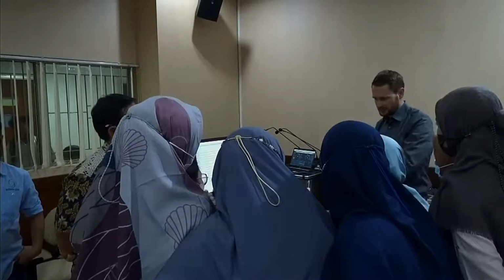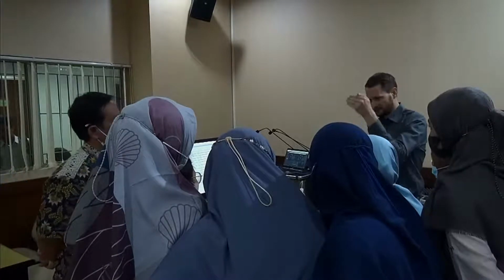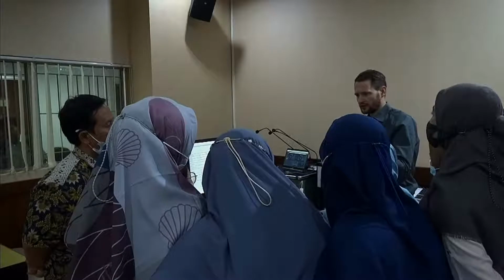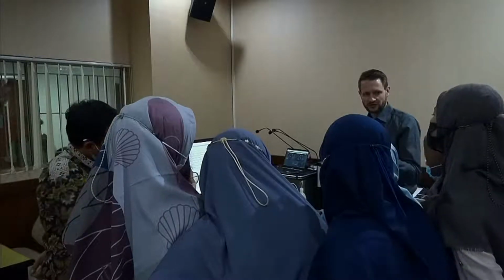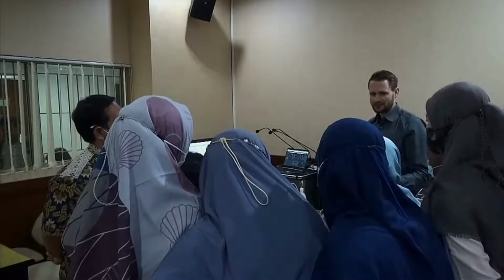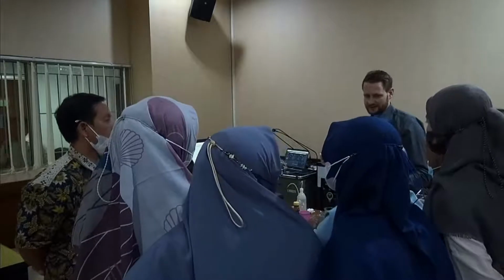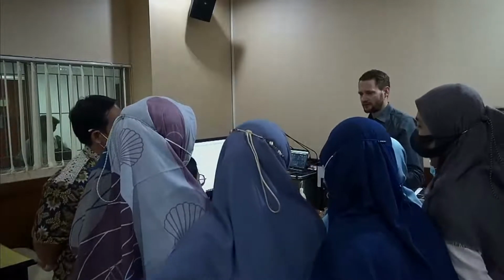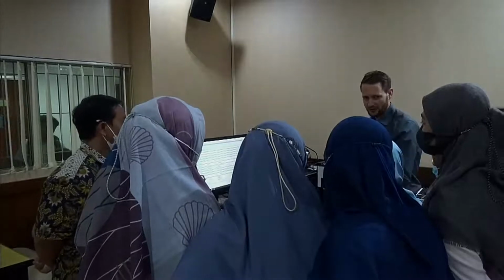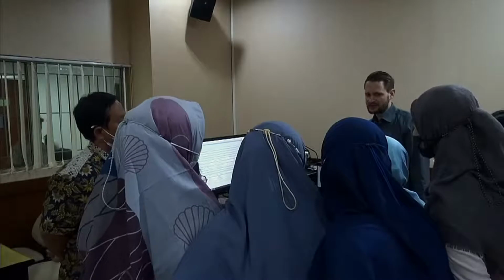We also have an add-on software where you can approximate the value. You can make a measurement, you can load the measurement in this, we call it Mie search, and then you can search different Mie parameters, and it will show you the results and the according measurement error. So it just looks where the measurement error is the lowest, and that might be a good value for the Mie parameters. But if you just go on the internet and you Google for refractive index, you'll find so many different parameters from different researchers. It's not a trivial thing that you just have a refractive index. So actually nobody in the world can tell you the exact value.